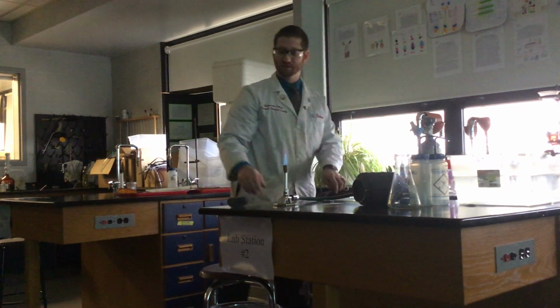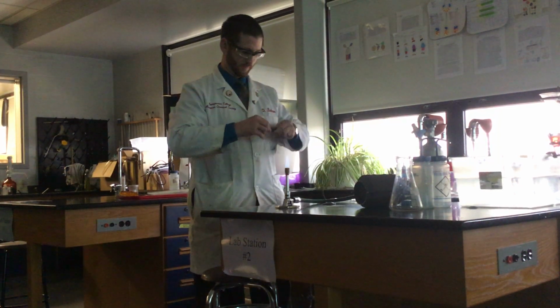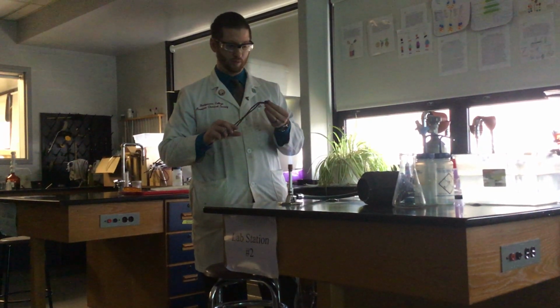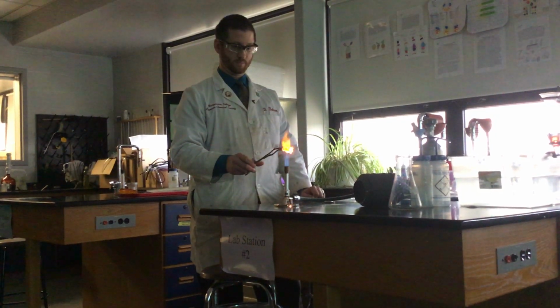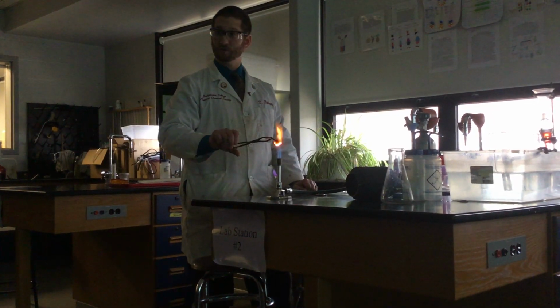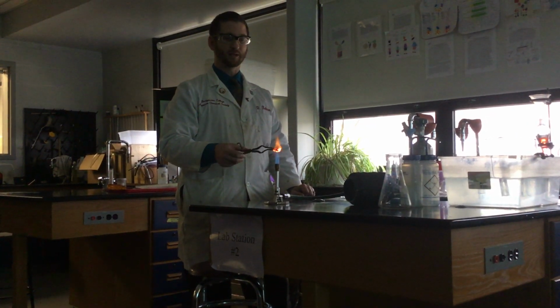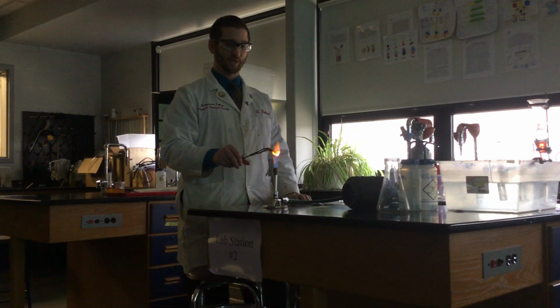Carbon mixed in. That's what makes it steel versus just iron. We get a little clump going here. So again, there's about 20% oxygen in the room. You can definitely see little combustion reactions or synthesis reactions going on. Iron joins up with oxygen, forming a rust, iron oxide. It's definitely an exothermic reaction. It gives off more heat than it actually takes to get the reaction started.